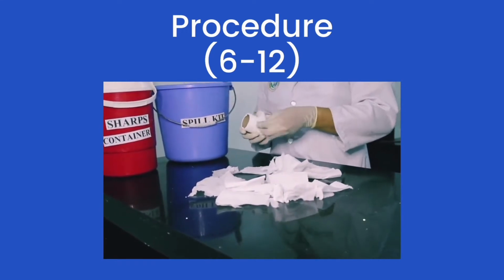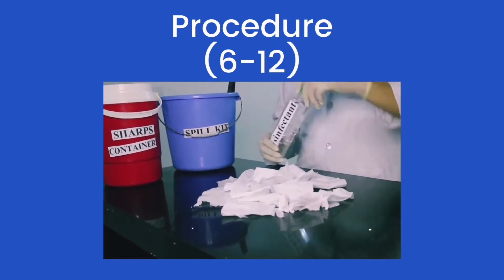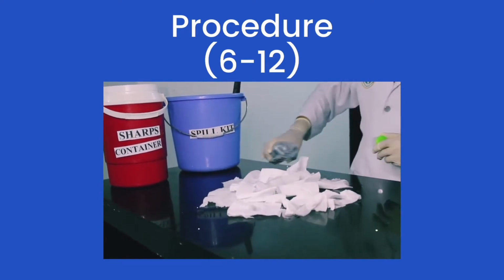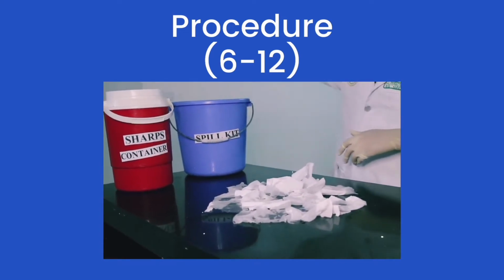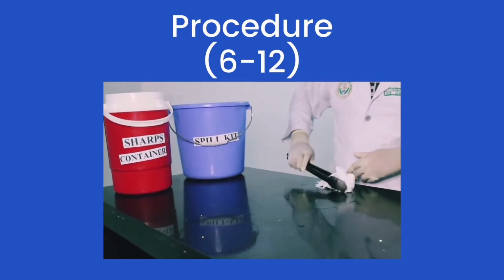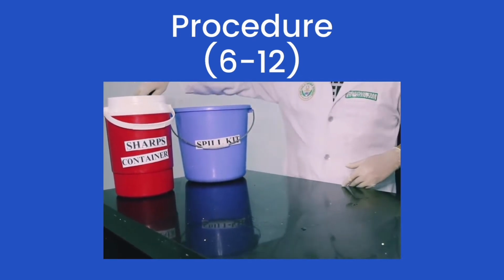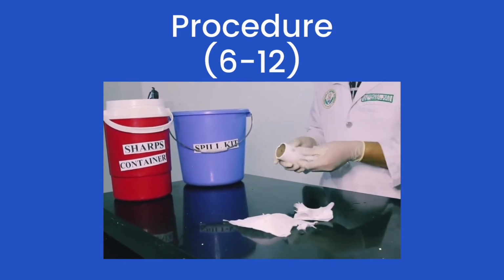In the video, I'm alone because it's a video, but please always go in pairs. Then I place absorbent material around and on the spill itself. Then we use disinfectant and pour it concentrically, starting from the outer part to the center, and observe appropriate contact time. Now we use our tongs to pick up our absorbent material and broken glass and put it in our sharps container or infectious yellow bag.